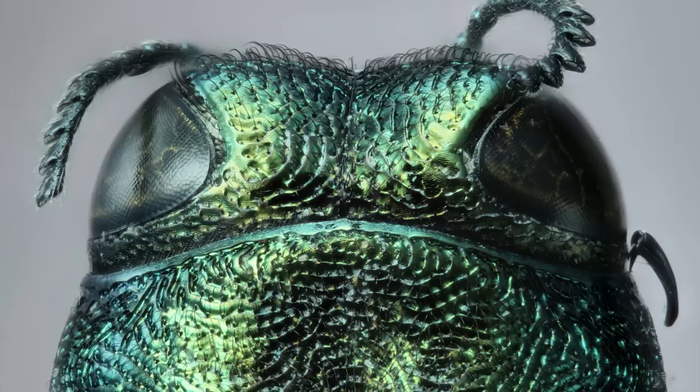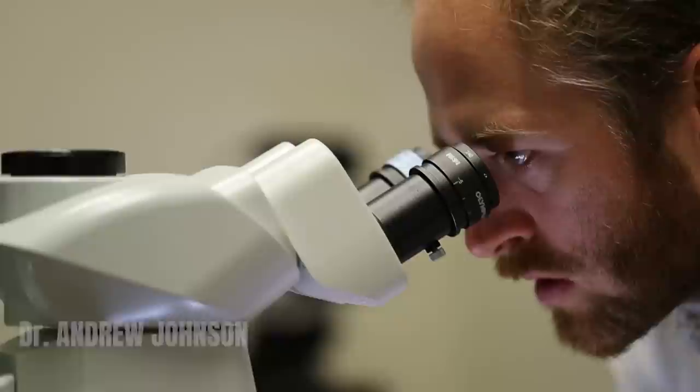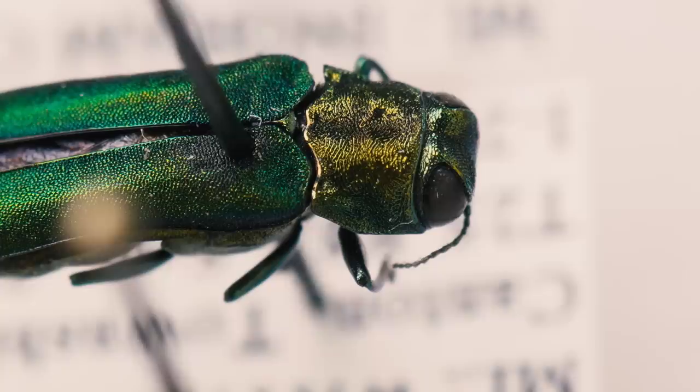Put your finger on the jar edge. Oh shoot, it dropped, okay. We are now in the forest entomology lab here at the University of Florida, and we are going to take photos of the emerald ash borer, how you will never see it with your naked eye. And there is a whole technique that goes into it, but that's why we're here with the experts.